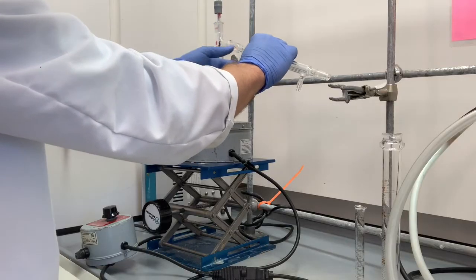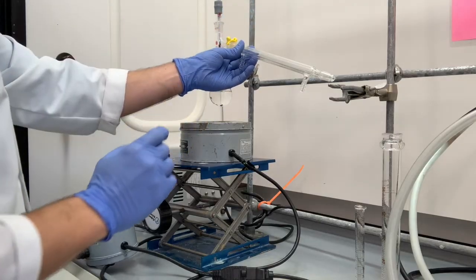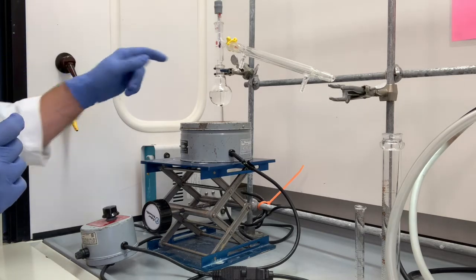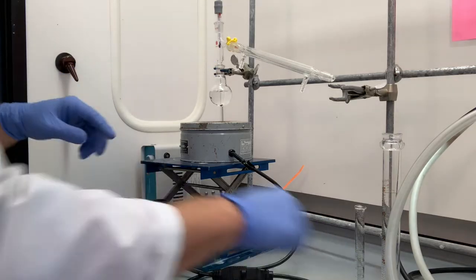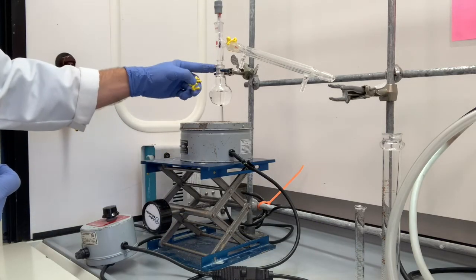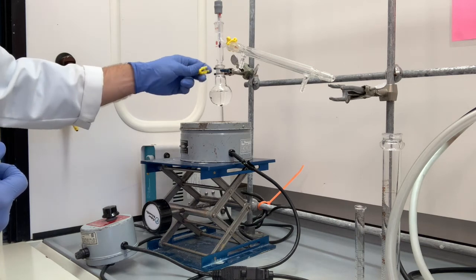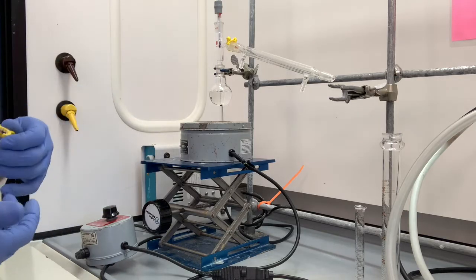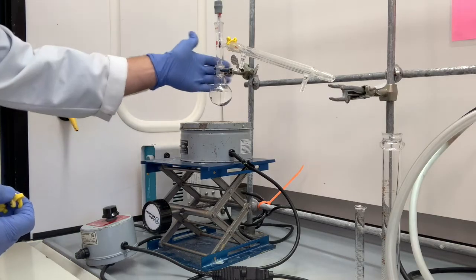So first we connect it. Now we're going to use one of the Keck clamps. That Keck clamp is going to hold this in place. Now you may be tempted to put a Keck clamp right here. Do not do that. If you put a Keck clamp here, you will screw up the way that this clamp is connected to the flask. It will actually weaken the connection. It will make it more likely to come apart. So no Keck clamp here, just the exterior clamp.